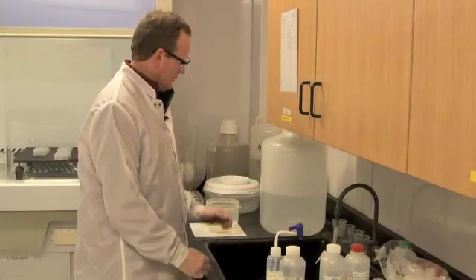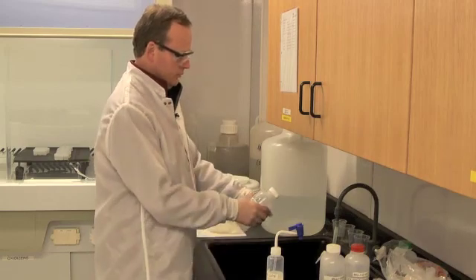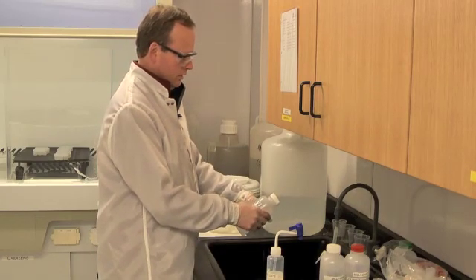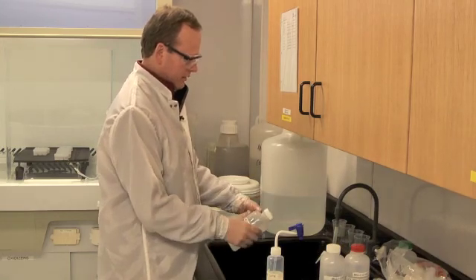We begin the process of setting up columns by carefully rinsing out the liquid in which the columns are stored. We do that by squirting water into the column and flicking it out several times.